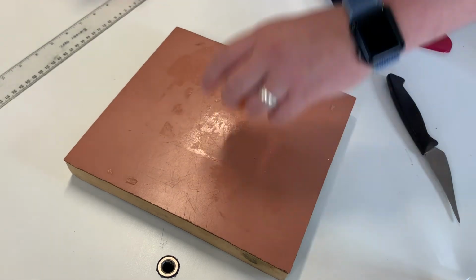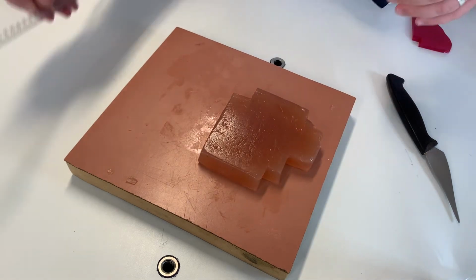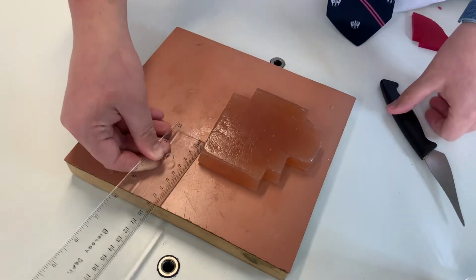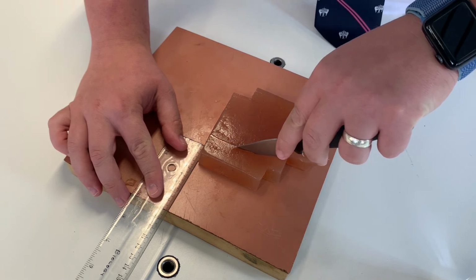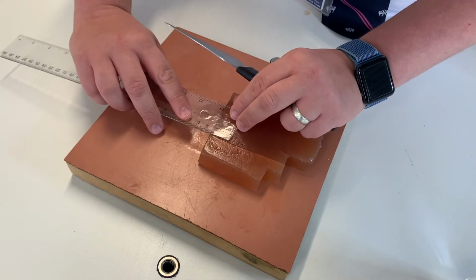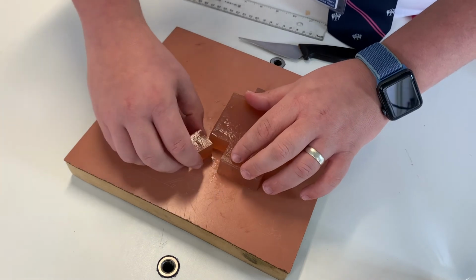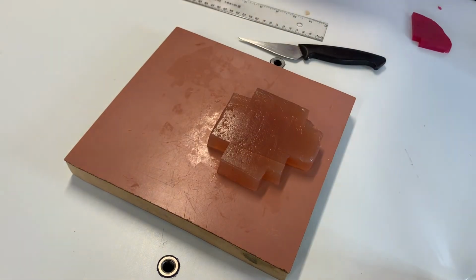We'll now do the same thing for agar gel that's 2 centimetres thick. So we will cut first off 2 centimetres long. And we have our agar gel cube of 2 by 2 by 2.